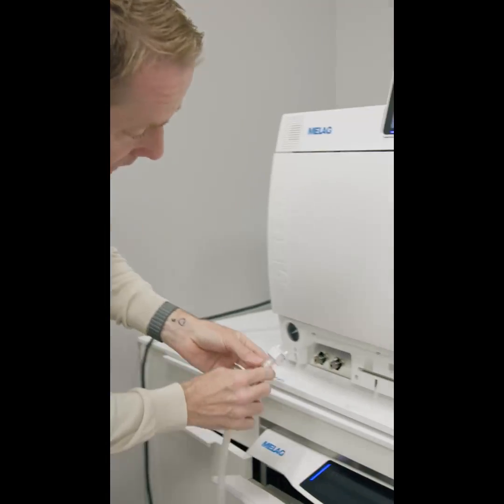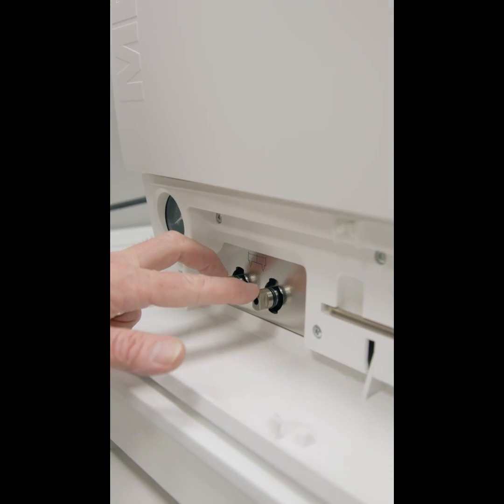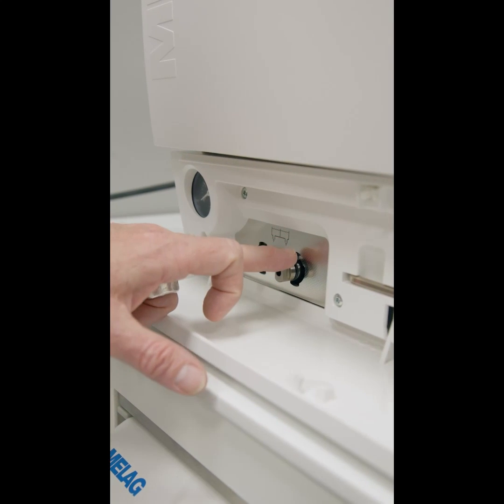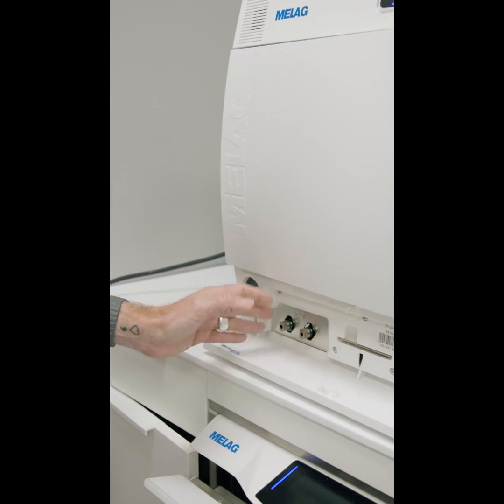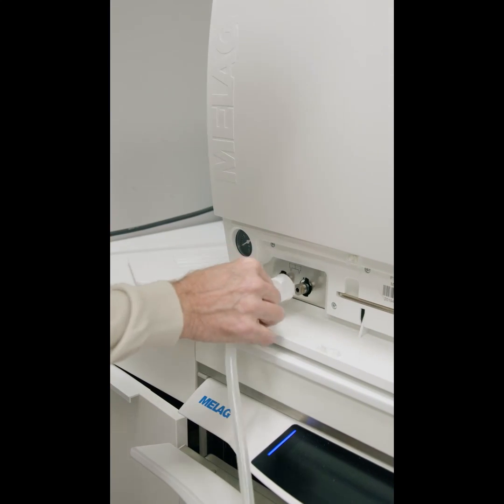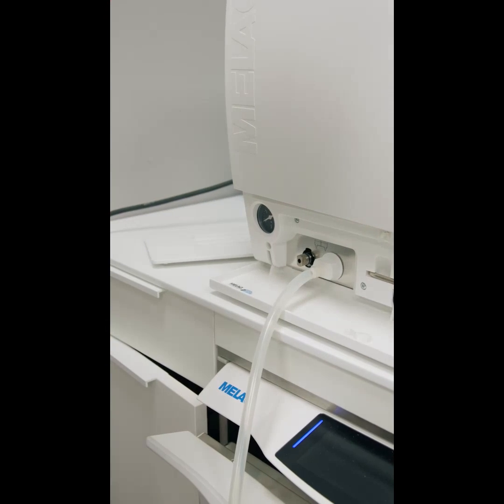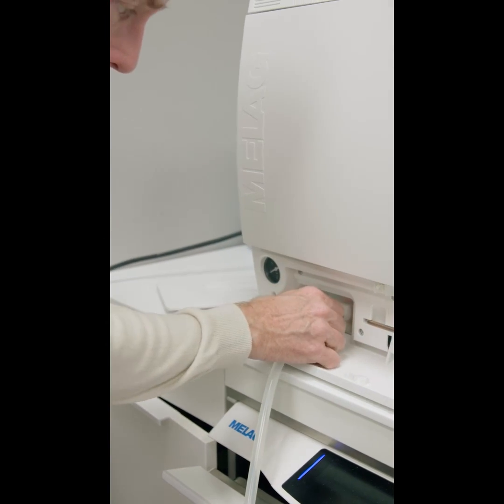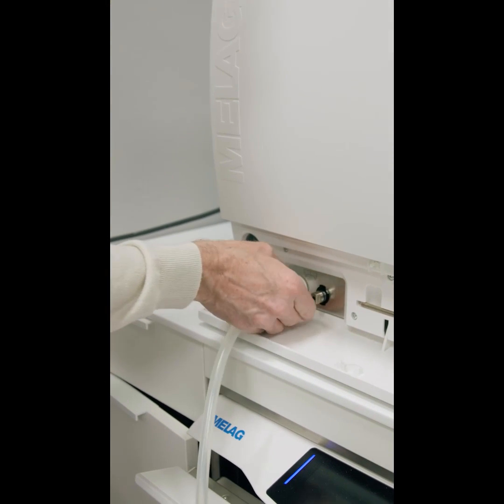With your steriliser, you would be given a tube. You would connect it up to the front. Normally the way these tubes are connected is the right-hand tube is the right-hand tank and the left-hand is the left-hand tank. You would place the tubing in a bucket, connect up the hose, and then the water will drain out into the bucket. Remove it and then do the same with the dirty tank as well.